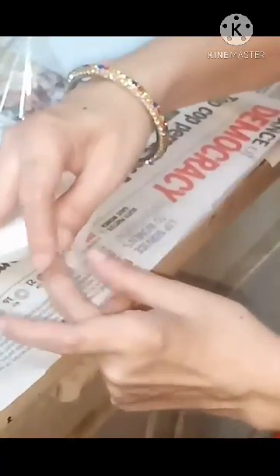Remove the excess ends of the filter paper because when we heat we have to remove these ends. Now place this porcelain dish with the filter paper on the tripod stand using wire gauze.